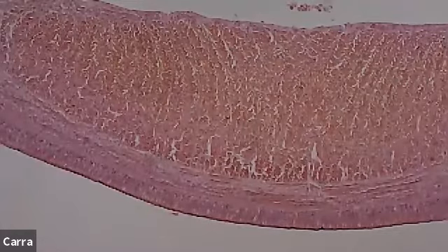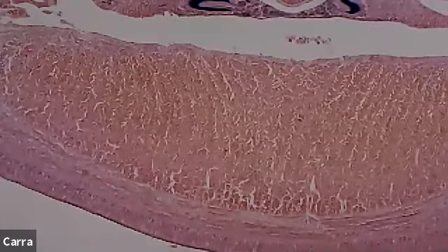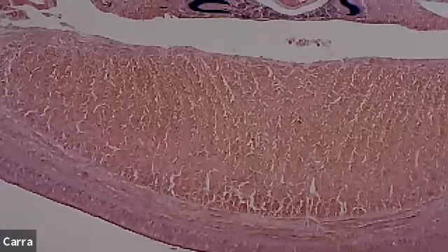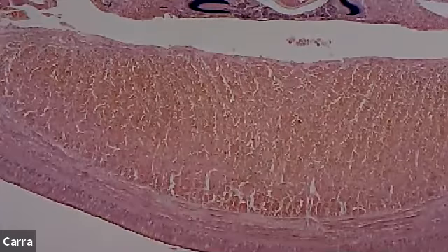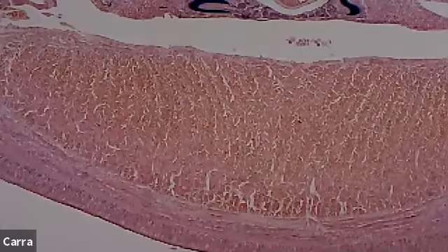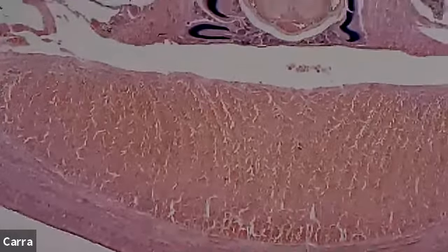And then we also have this really thick layer that we're looking at. That's the longitudinal muscles, all right? So they have 2 different kinds of muscles, which is indicative of just complexity, right? That's more complex than one type of muscle. And that's what happens when you have that coelom formation. Things become more complex. So let's look at how else this organism is more complex.